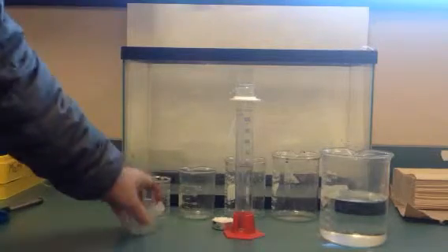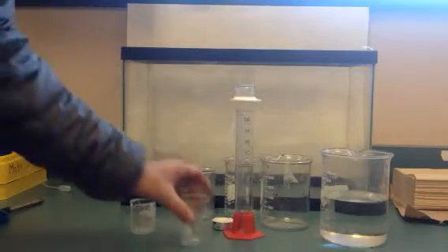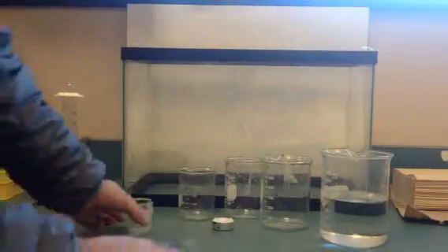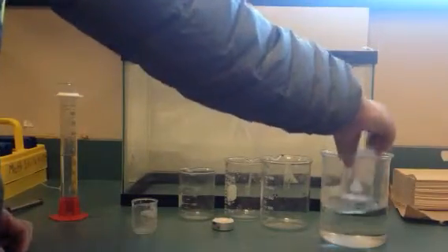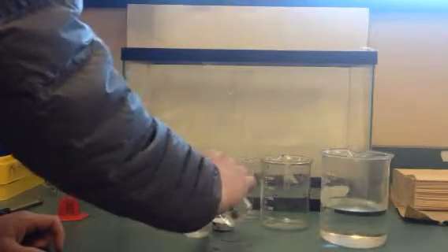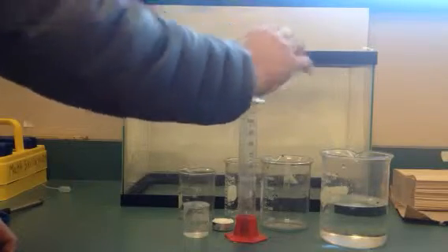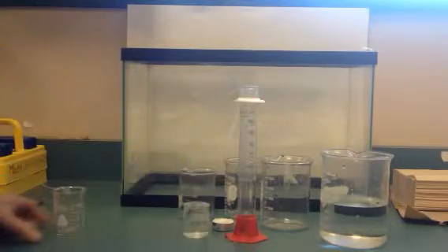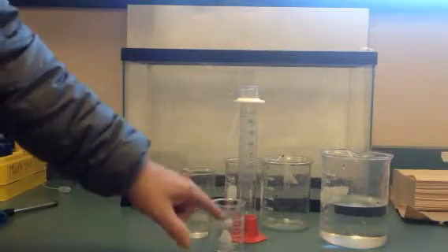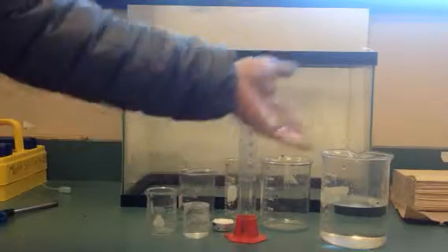Now that method works pretty good, but once we get to these big beakers, it's a lot of pouring of water. So what most students did is, let's say they knew this one right here was 60, they set that aside. They'd fill the next size up with water. They'd pour this out, and they knew they poured out 60 milliliters. And then they would pour that extra water into a graduated cylinder. And they'd say, well, if I have 60 here plus 50 there, I know this next size up must be 110. So one of the things you have to do is write the procedure for how to do that.